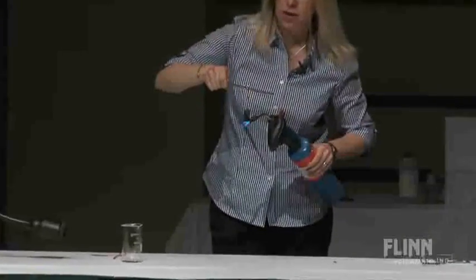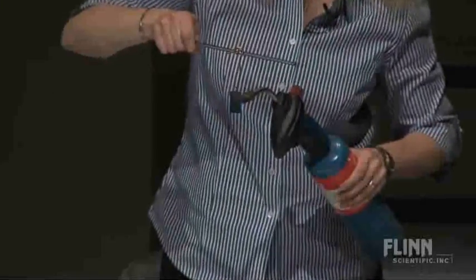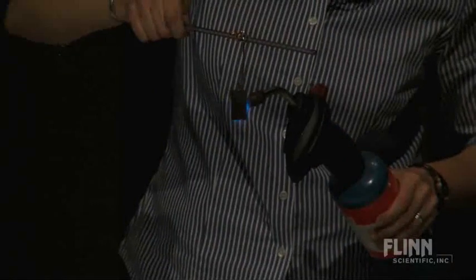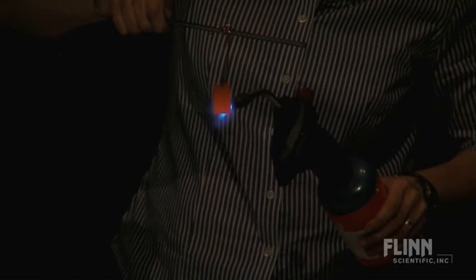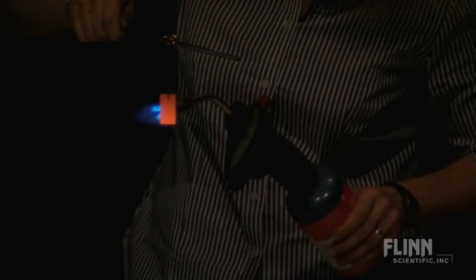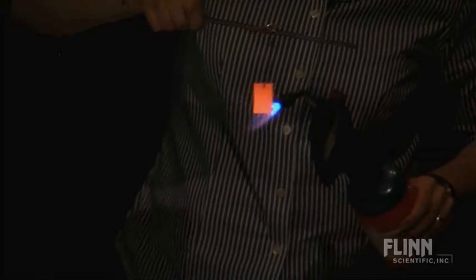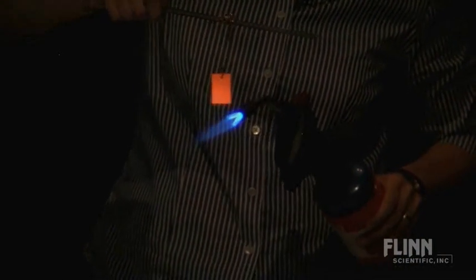Okay, now if we can dim the lights in here big time, almost out, all the way. Now this is the gamble, because I wasn't sure what kind of lighting we have. From where you guys are sitting, can you see what this copper is doing? We can even take this down a little more. You think that copper is warm? And everybody says yeah.